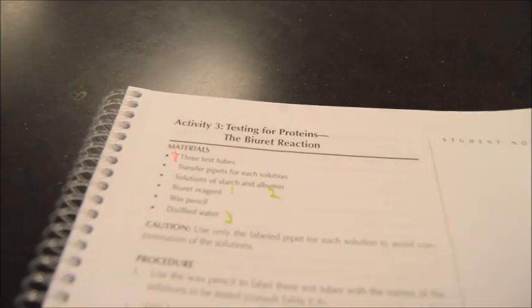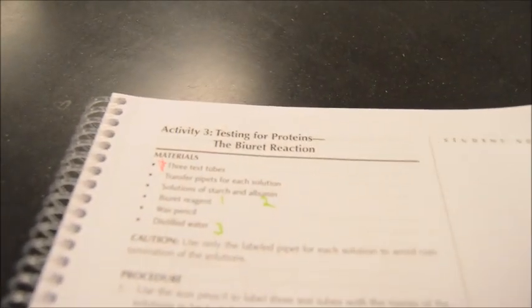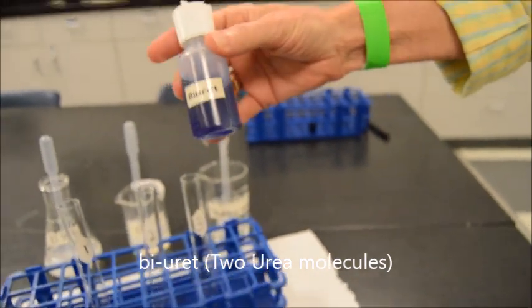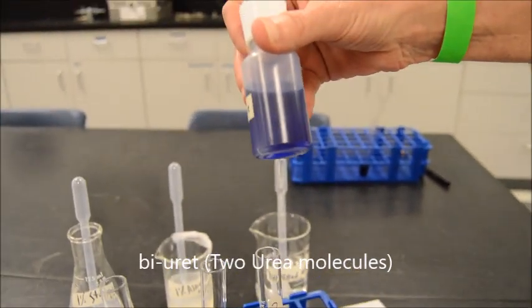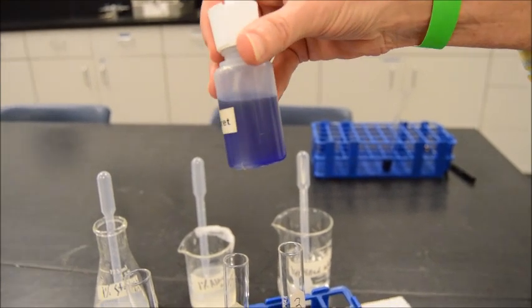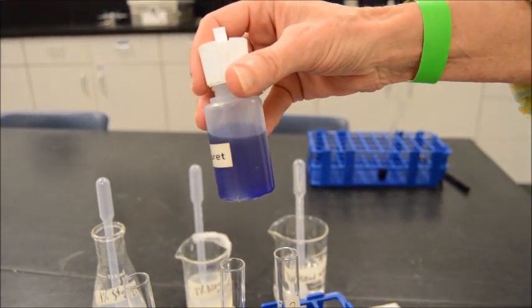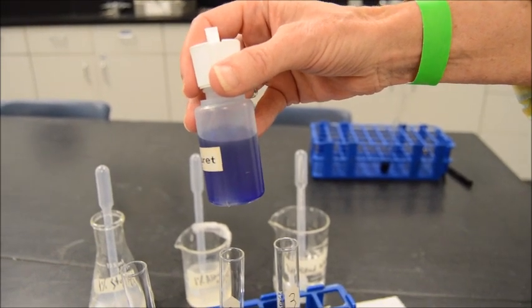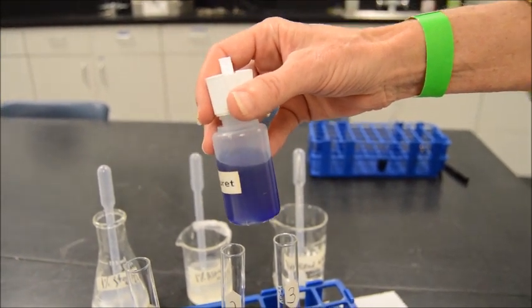Our next experiment is going to be for proteins. This is the Biuret reaction. Now recall that our fluid here is a nice midnight blue. And what we're trying to see is if this has the presence of proteins, of peptide bonds, if you will, we're going to find a deeper purple, like a purple violet.